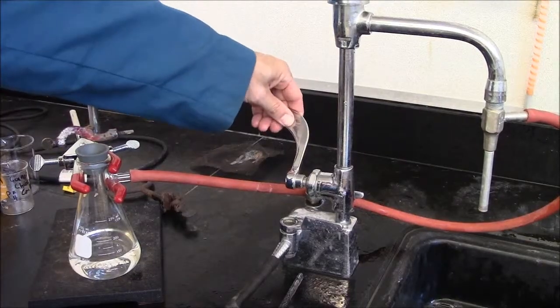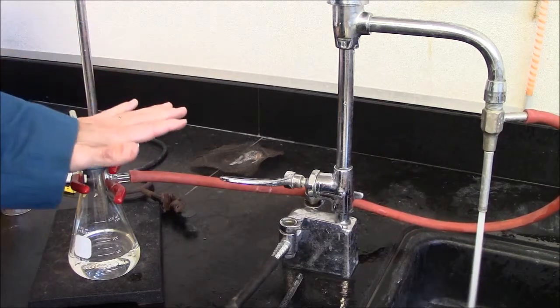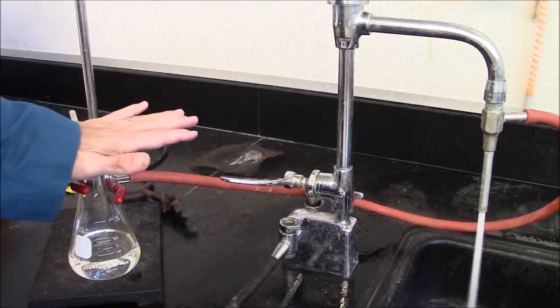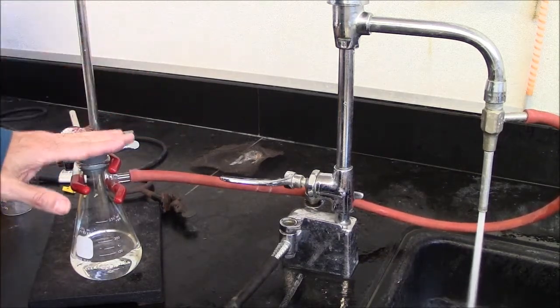Now if I turn on the water, it starts sucking air here. So this is a vacuum on this side.